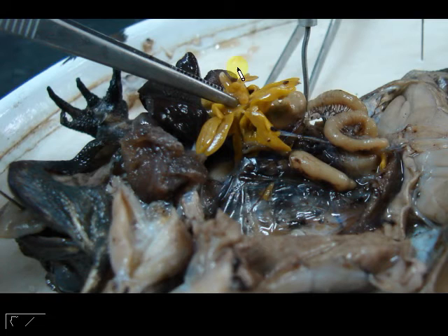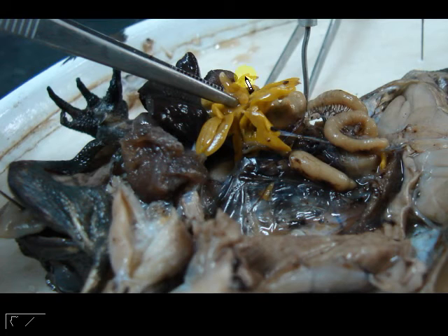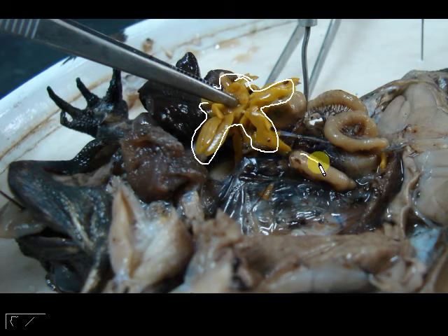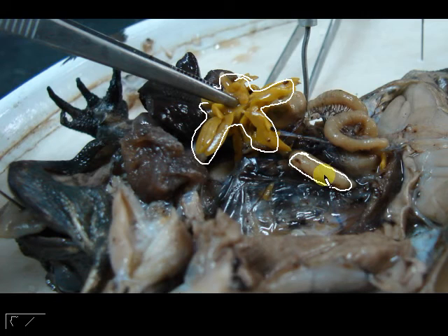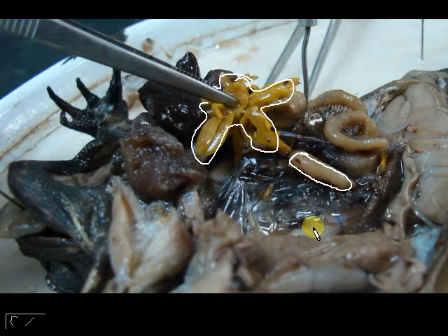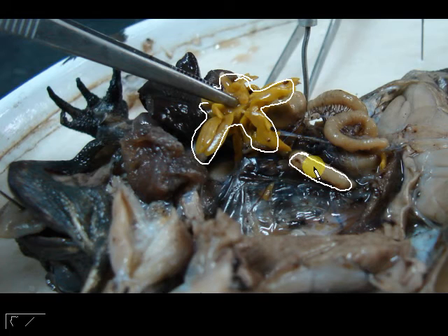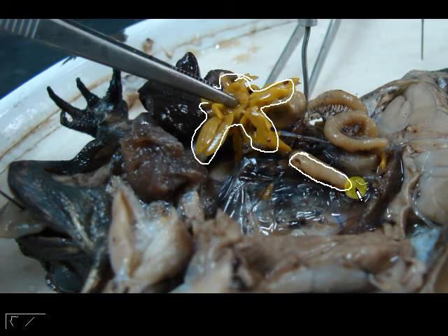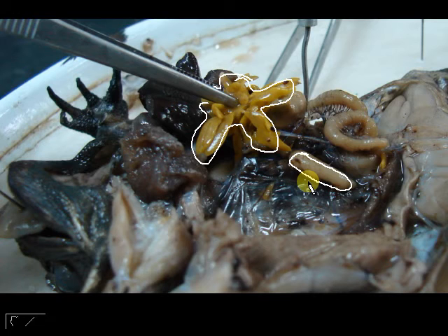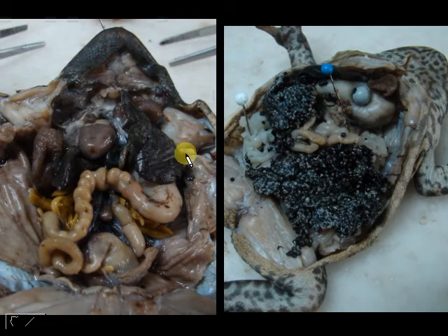Now let's move on to the reproductive systems. The part held by the forceps here is called the fat body. And then this other structure is your testis — there are two, one on each side. Your testis sits on top of the kidney in your male toad. To distinguish it from the intestine: it is an isolated bean-shaped structure that does not occur in a long tube, and it sits on top of the kidney.